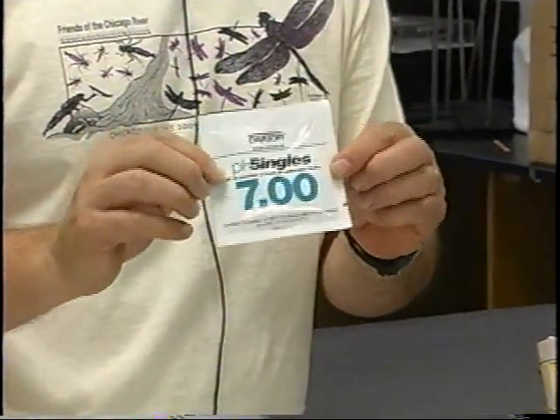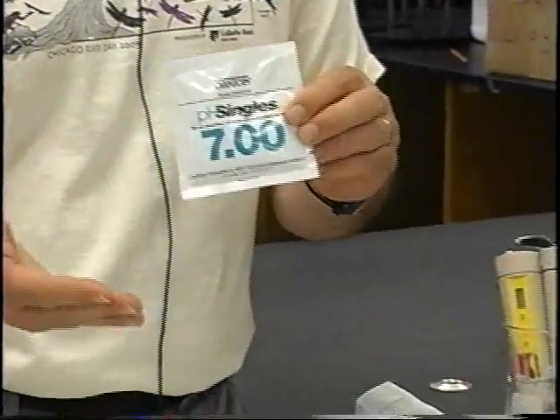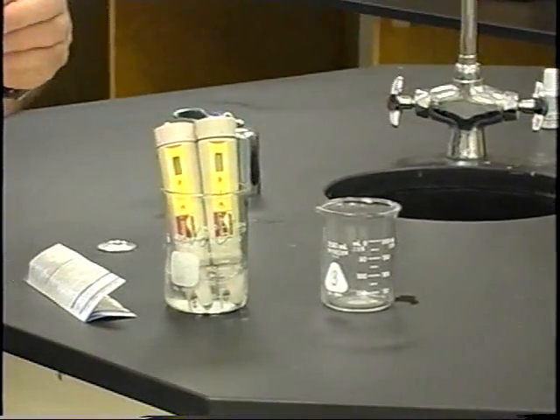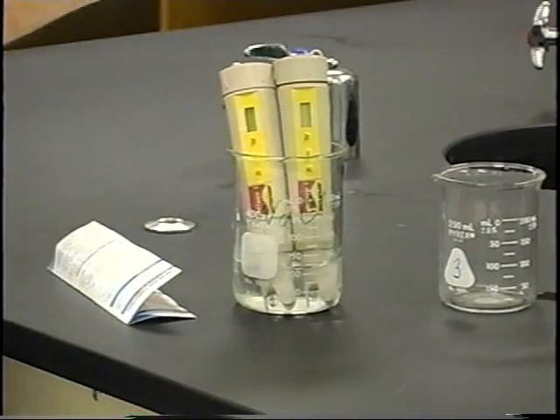This is, as you recall from reading a little bit about what pH is, neutral. Anything below a 7 is an acidic solution. Anything above a 7 is a more basic solution. So this is set right at 7.0, and it's a buffered solution that will hold its pH.